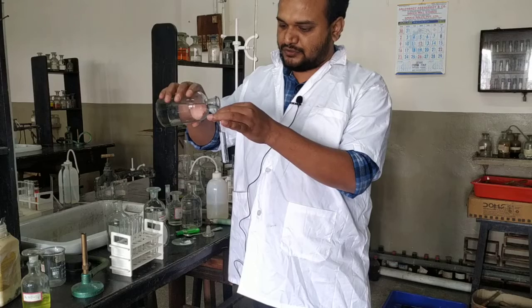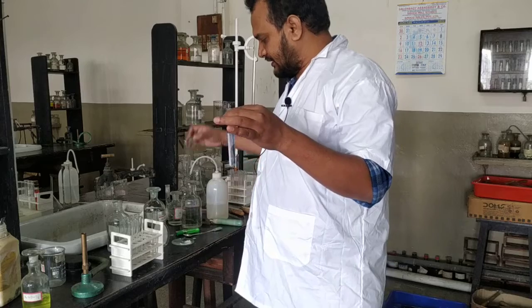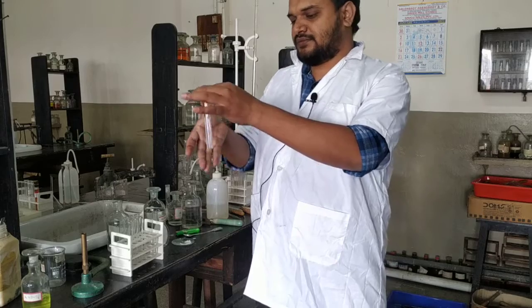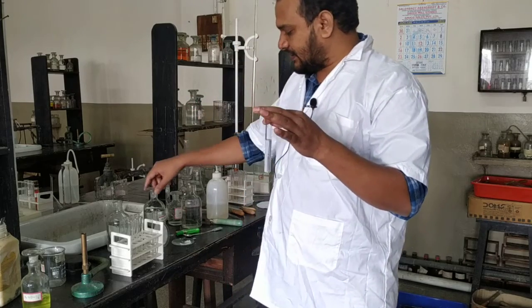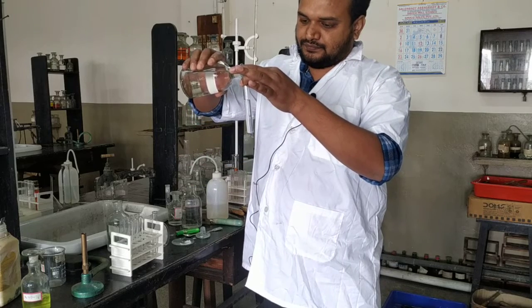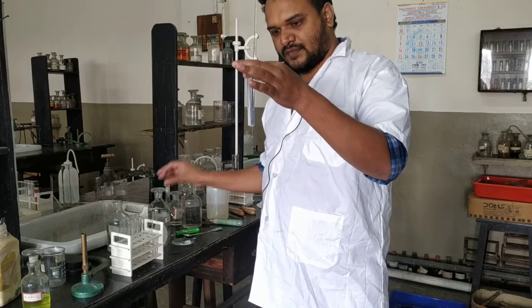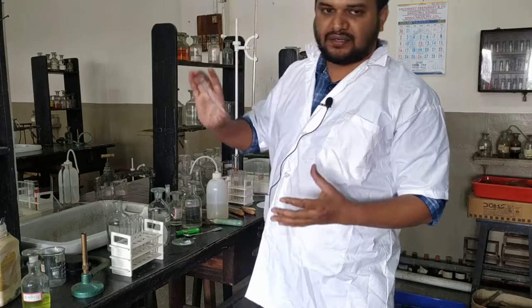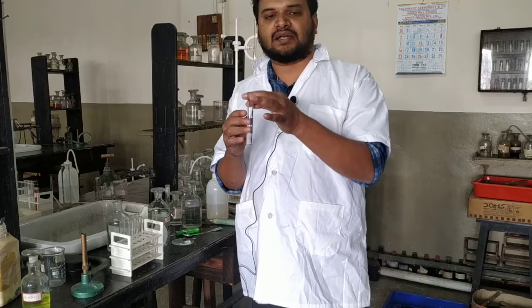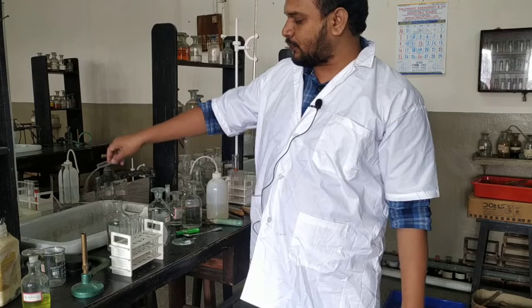See, in spite of adding sodium sulfide, there is no precipitation. It may look like precipitation is coming, but if you shake it, no precipitation. If you add a little more HCl, it will dissolve. If you get a heavy, thick, insoluble precipitate, then only you say group 2 cation, that is copper 2+, is present, but precipitation is not coming, so group 2 is also absent.